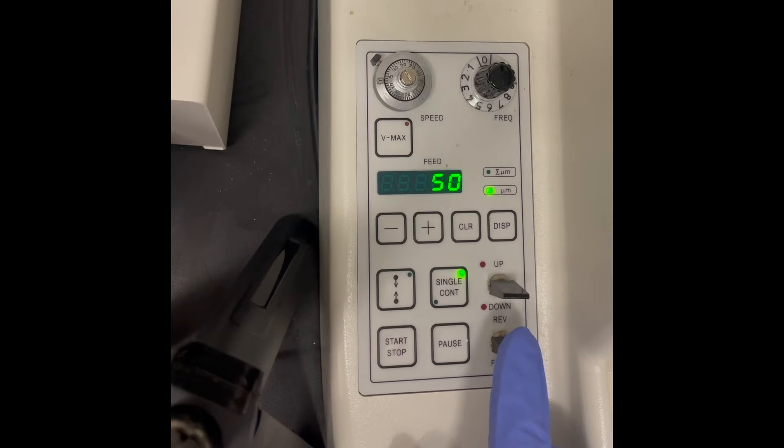To set start cutting parameters on the horizontal plane, move the blade forward to about 5 millimeters away from the tissue and press the double arrow button. To set the finishing cut parameter, move the blade past the edge of the tissue with a clearance of about 5 millimeters and press the double arrow button again.